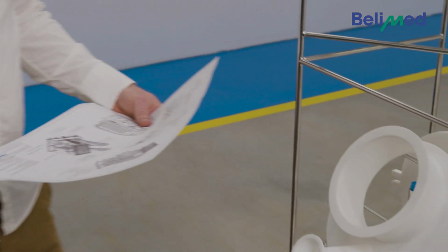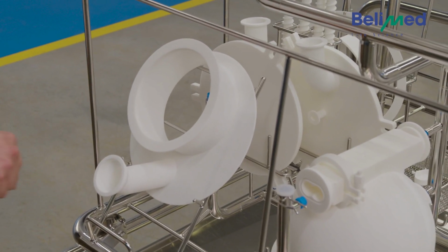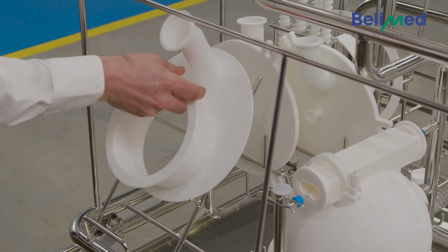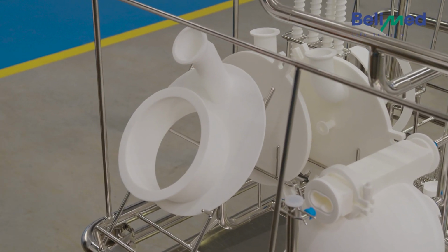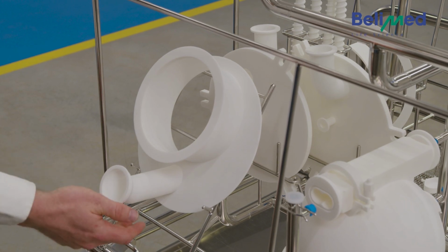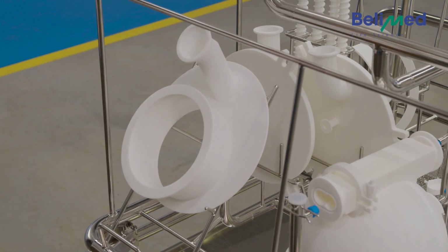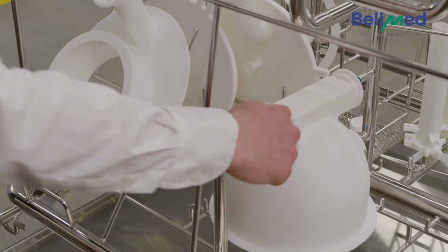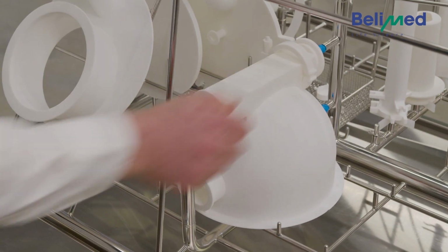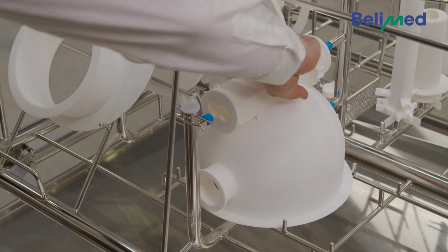So another part which is placed incorrectly is this one here. It's really hard to recognize on the loading scheme, but actually this one needs to be turned around because here's a nozzle, and this part inside here needs to be cleaned, so it must be hung up exactly like that. Also, the risk when you turn it this way is that water can get stuck down here, so it's probably not getting dried afterwards. So this is the right position. The other parts here look fine. The nozzle is going in here, the other side here, that's also correct. It would also be possible to turn it this way, but that would be incorrect and also really hard to see on the loading scheme that this is not correct.